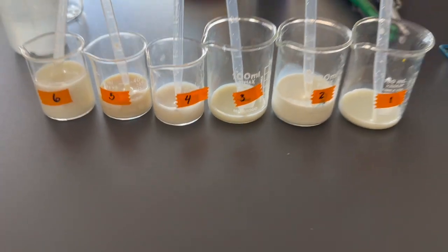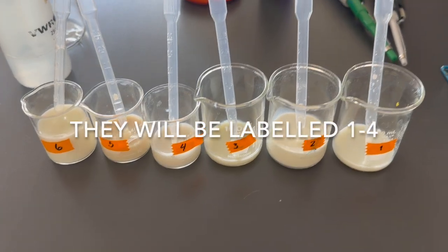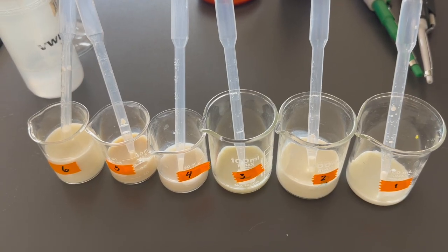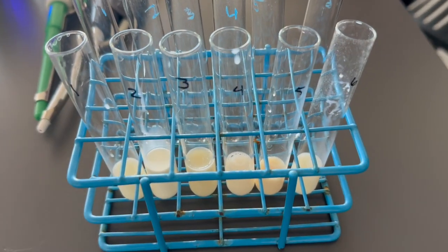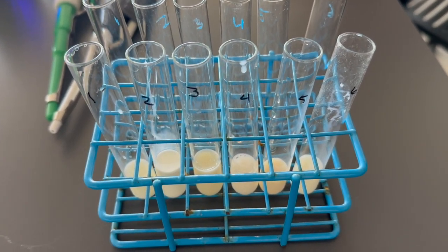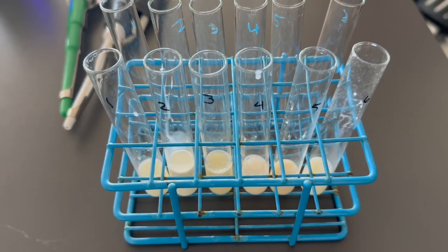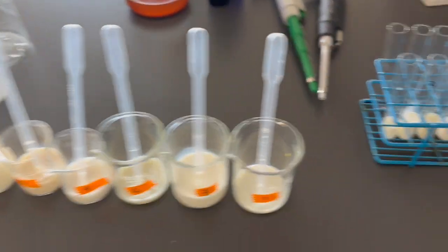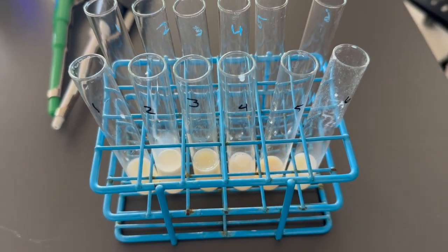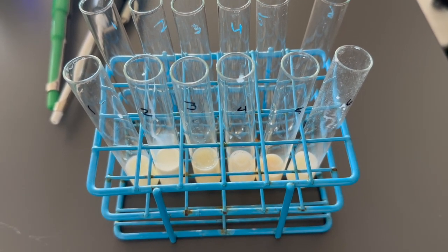We have our beakers. Each lab room will have beakers with milk and milk products labeled 1 through 6. Instead of students running around the lab and grabbing milk from one place, each table will come and get their working solution of milk and milk products and bring it back to their table in test tubes. About 3 mLs, and this doesn't have to be exact, they can measure with the bulb pipettes. They can measure about 3 mLs of each solution and bring it back to their table to perform their 3 tests. So this will be their working solution to do each of the 3 tests.